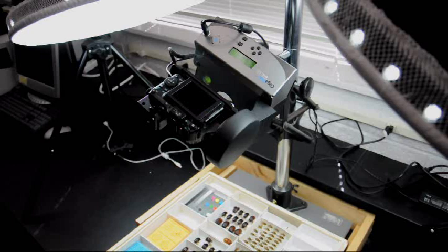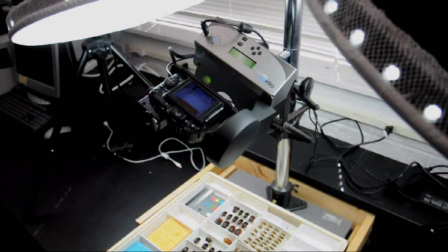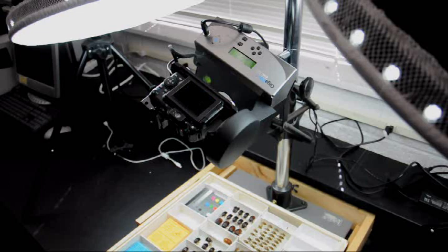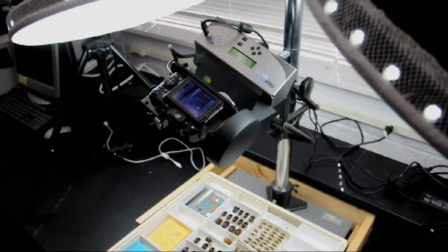After setup, if the final position remains, all that is needed is the last panorama function on the robot to shoot every new drawer with the same dimensions.